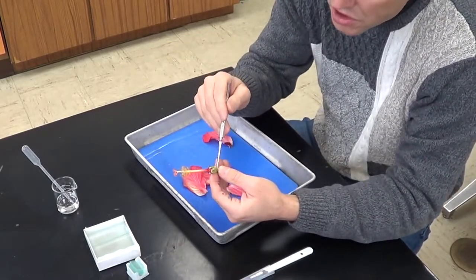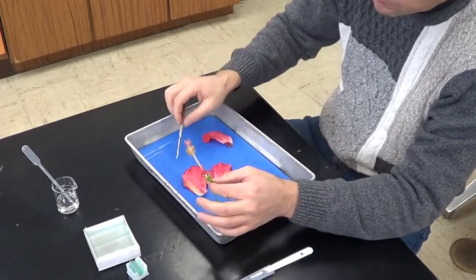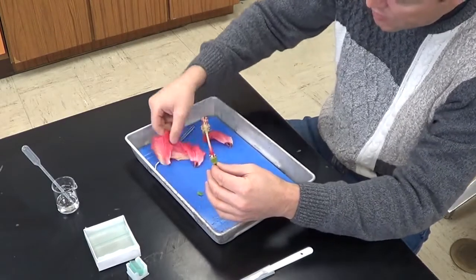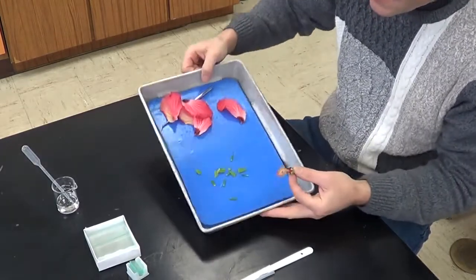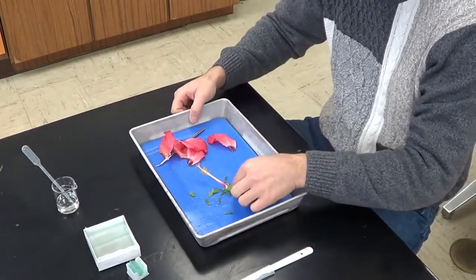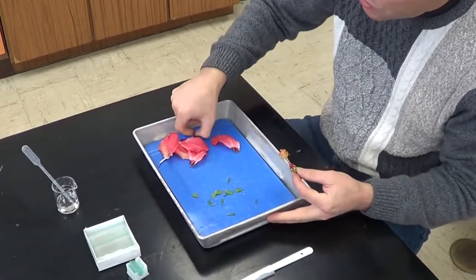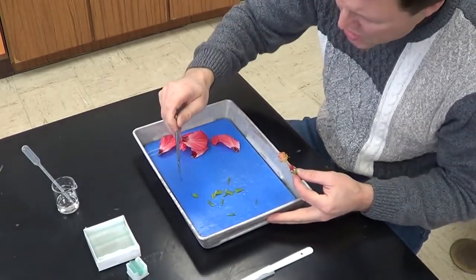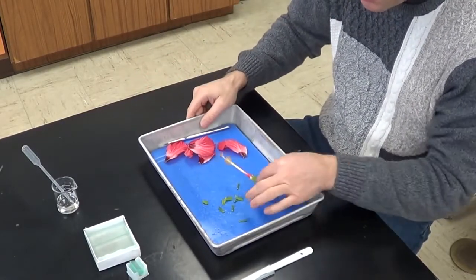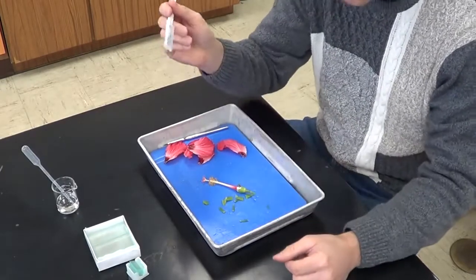Now down here, this is going to be the ovary, and we're going to cut that open in just a second. In fact, let's go ahead and do that right now. So I'm going to move this out of the way. I've got my dissecting tray right here, or dissecting pan, and I'm going to put this in here. And I've got this rubber mat, and the rubber mat is not used to hold instruments. You don't stick instruments in the rubber mat, it just destroys the rubber mat. So we don't want to do that. It's only used for cutting, so we don't dull the blade of our scalpel.